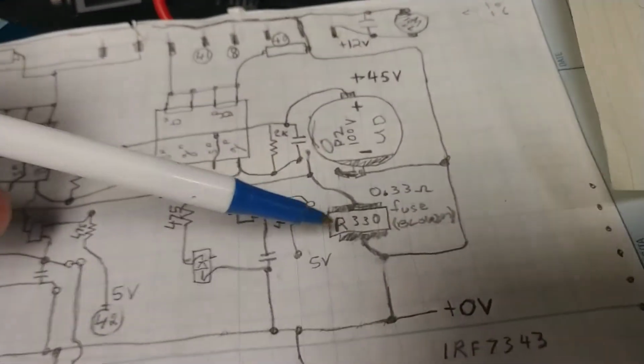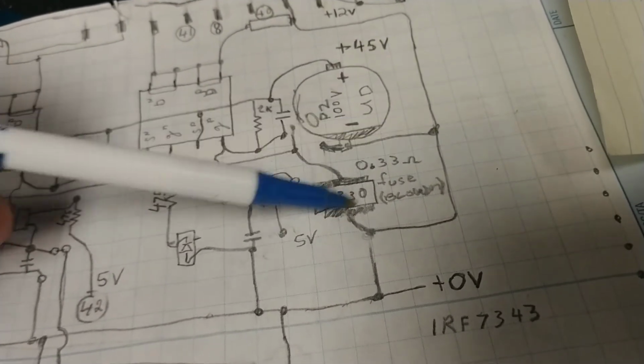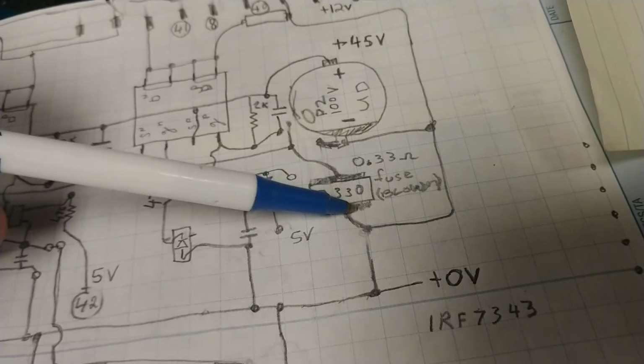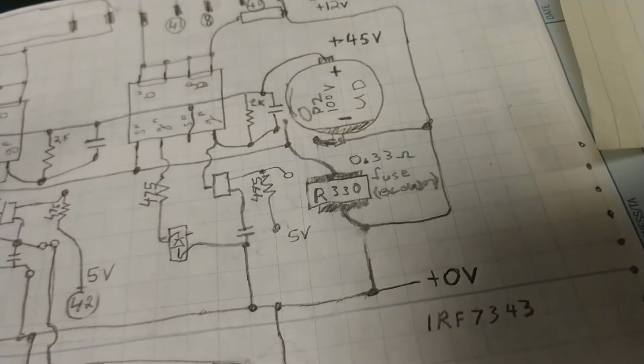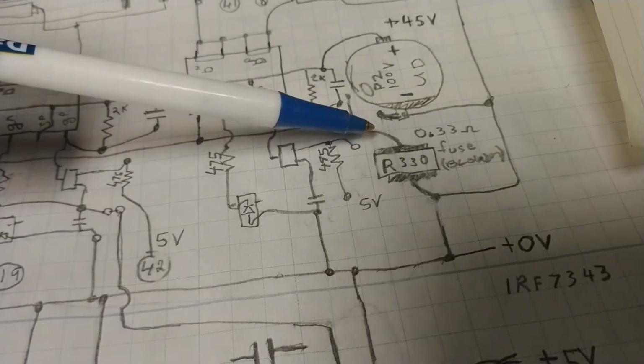Well, that was blown. In other words, it was not reading 0.33 ohms, it was reading a few mega ohms or even an overload on my ohm meter. That was blown. That means I gotta go hunt that up and buy it.